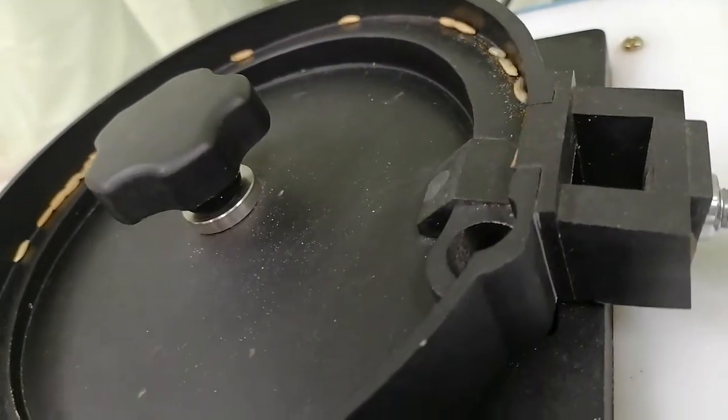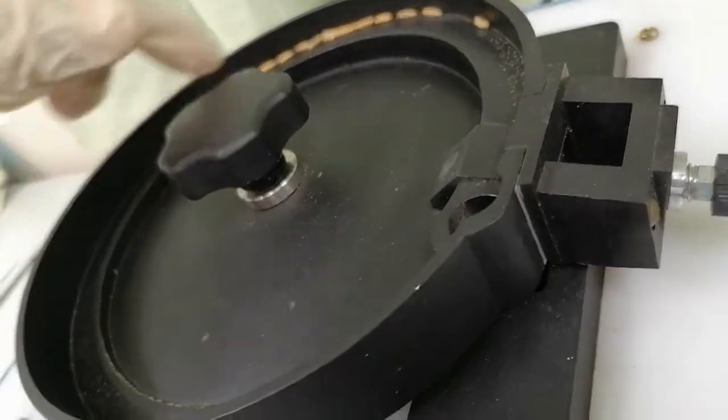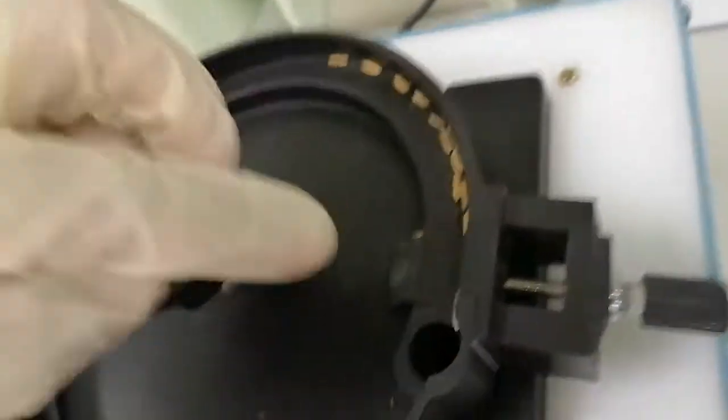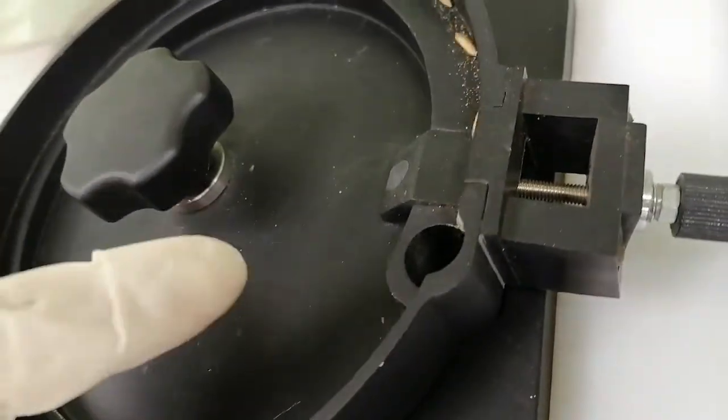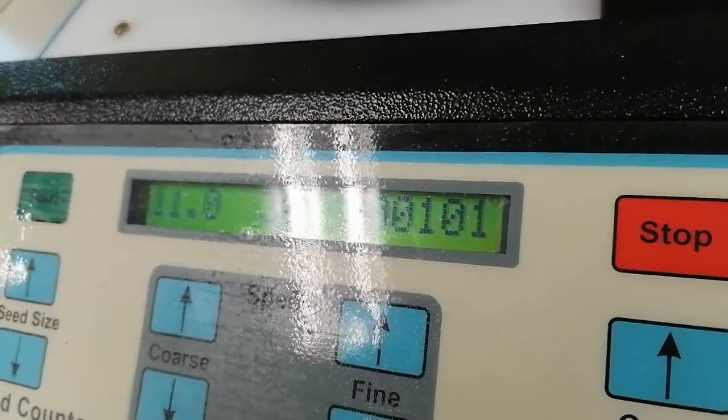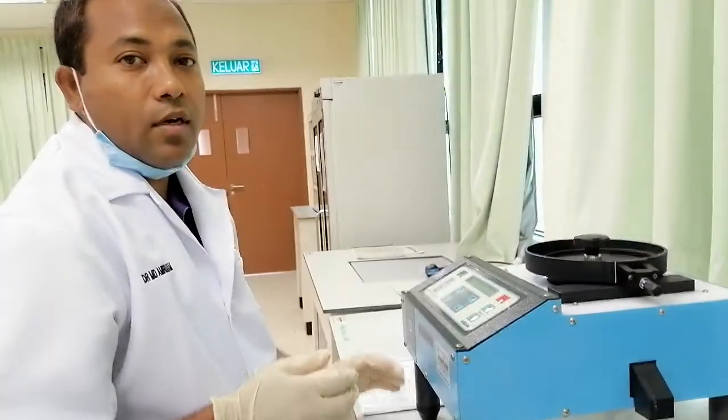There is a like floating way. Moving from the periphery to the central and again going to the periphery to go to the hole for counting. So there you can see, already 100. So I am showing 101. The last one maybe. So the machine is already stopped. This is the machine for seed counting.